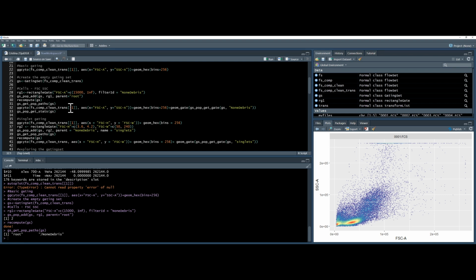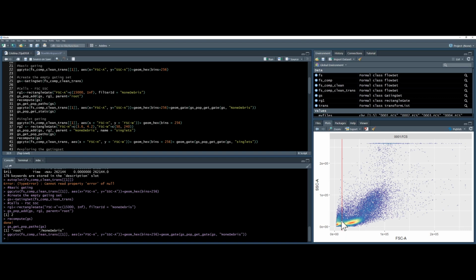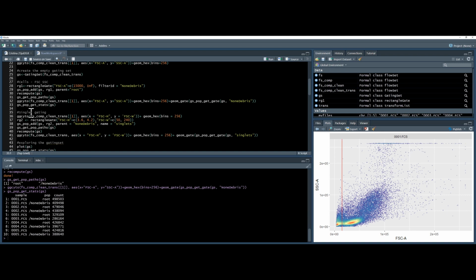So using ggcyto, I can look at my forward scatter and side scatter and include the level of resolution, and I can add the geometric gate non-debris. As I said, I'll go through later in another video how to use ggcyto properly. But this will visualize my gate. You can see I've got a red line at 15,000 channels, and everything to the right is gated as non-debris. If I want to look at some statistics, I can use the command gating set population get statistics, and this will produce a count. And we'll talk more about statistics later in the video.